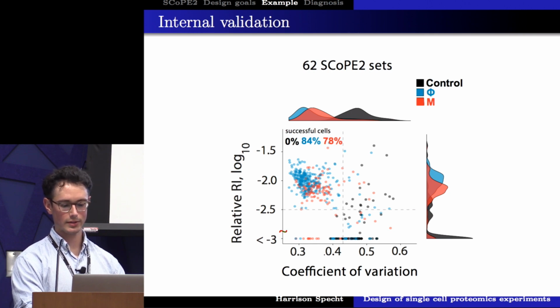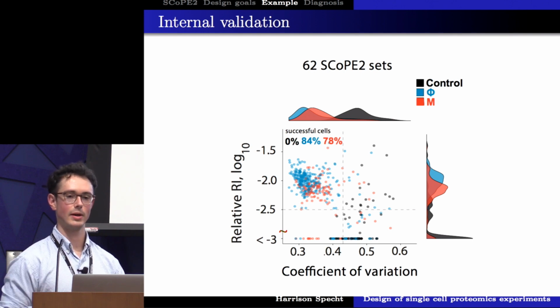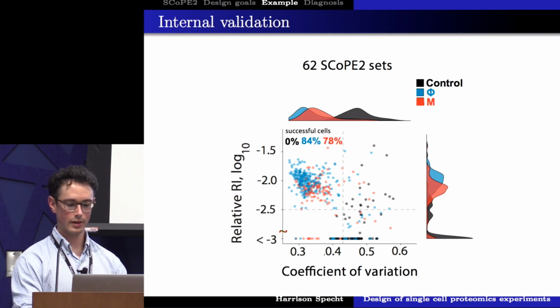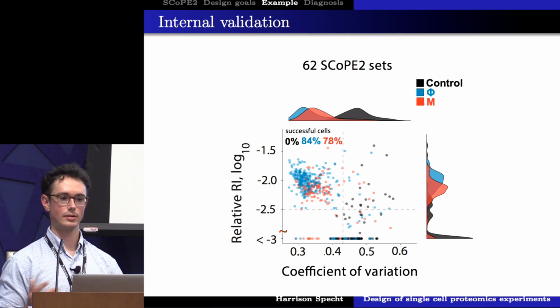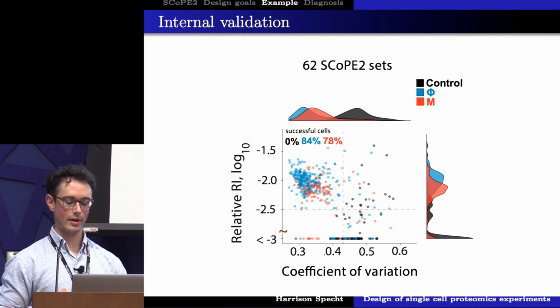And then likewise, we can see that the signal coming from our control wells is consistently lower than those wells that we sorted single cells into. So from this sort of metric, we can define metrics of success. And we can find that we prepared about 80% of our sorted single cells successfully. And we can use that data to have higher confidence in our later interpretation of the quantified proteomes.